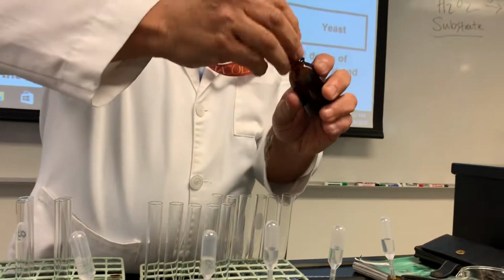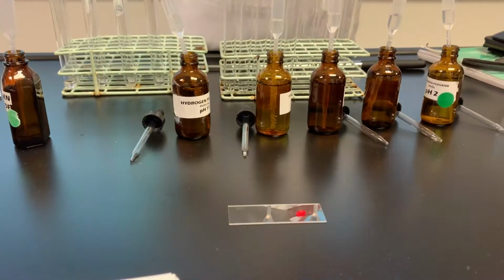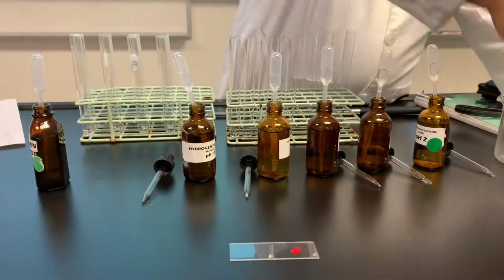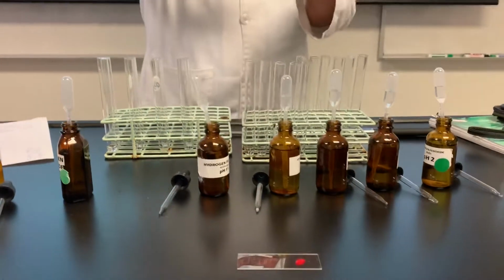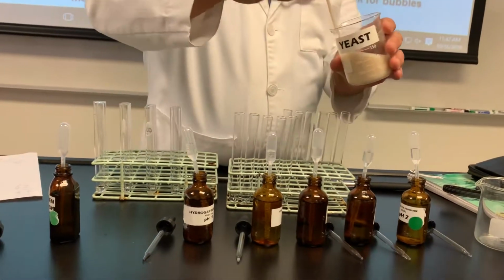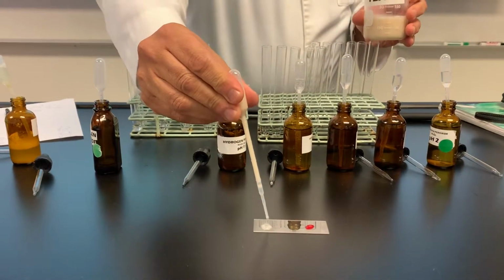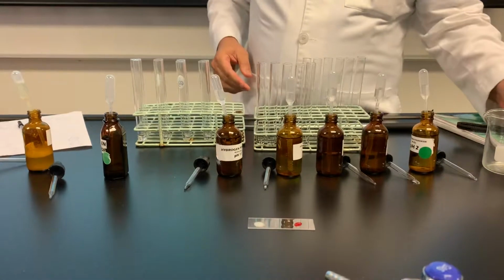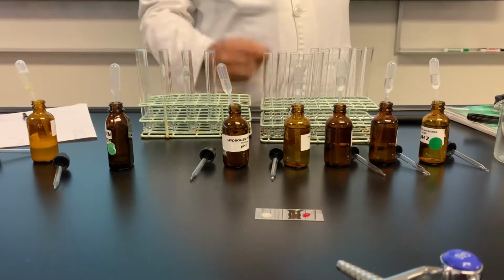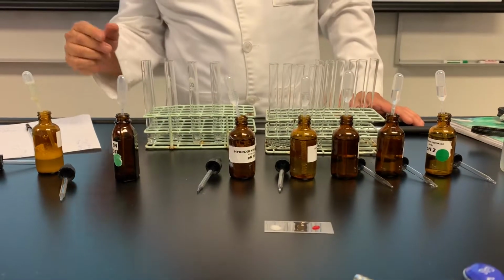Here's a drop of blood on the slide. Oh my God. This is sheep's blood. It's not my blood. Thank God. I'll bleed for you, but not today. All right. Let's see. And here's a drop of yeast. Maybe 2. Okay. Look at how much yeast they give us, and that's all I use. It's amazing.